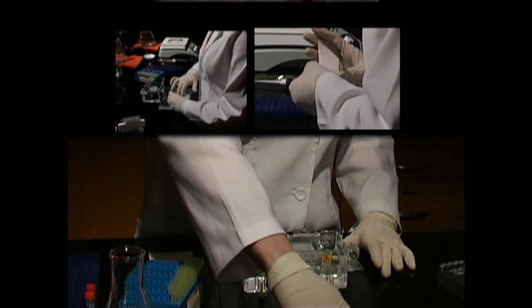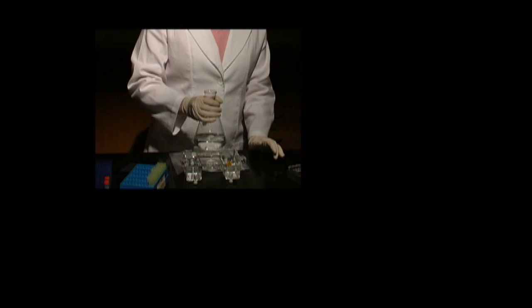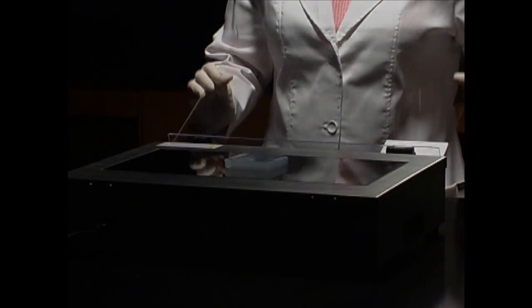To make the isolation more apparent, stain the gel for transillumination. When it's ready, take it to a transilluminator to view the bands.